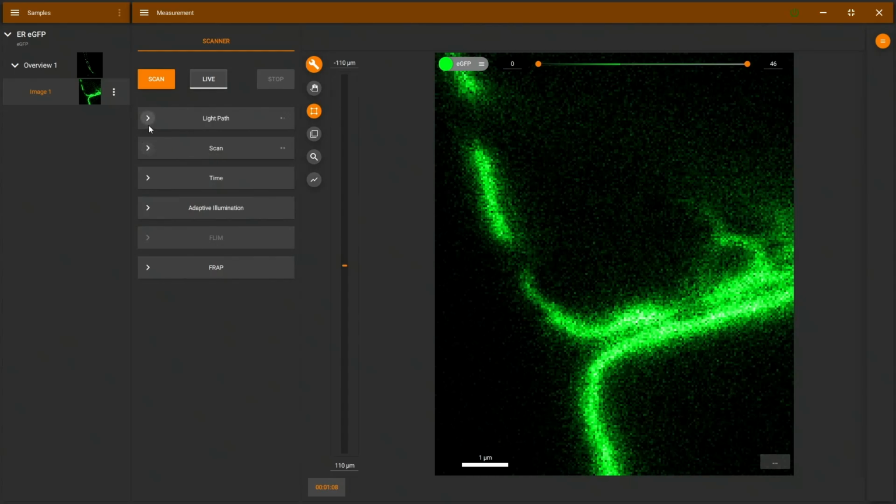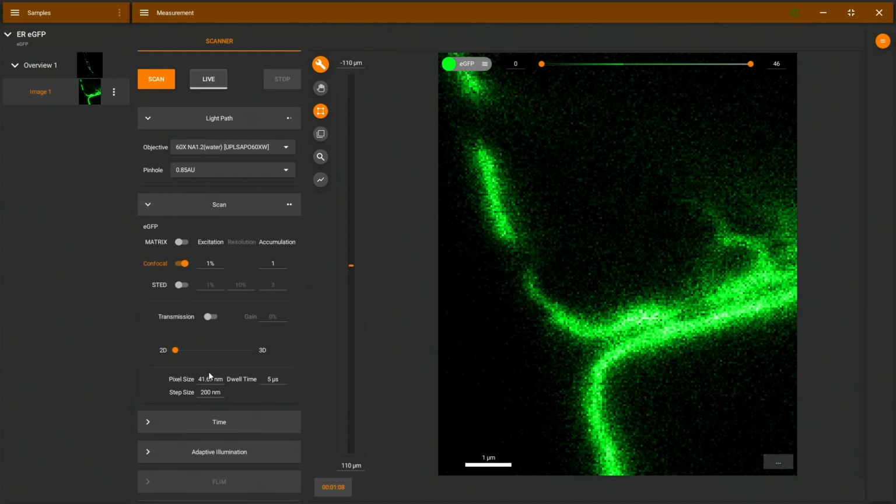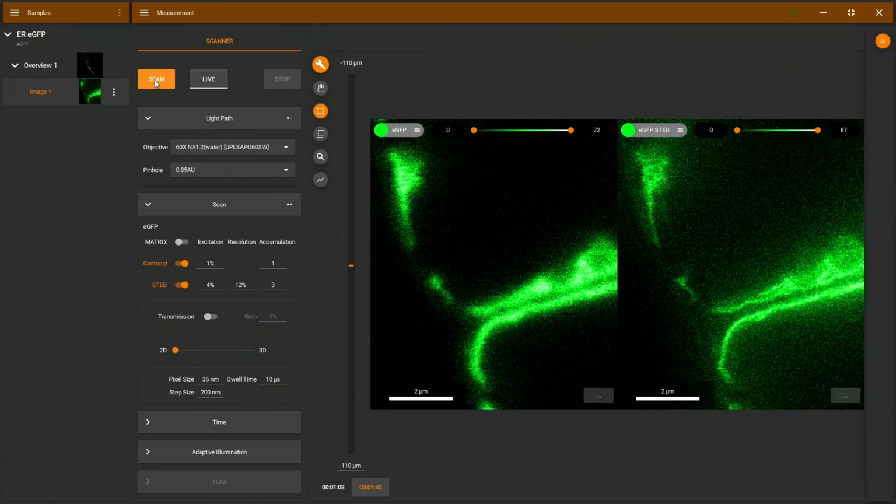So let's see, we go to the scan menu, we make the pinhole a little bit smaller, just to keep it fair in comparison. We will also make the pixels smaller for super resolution. We will crank up the dwell time a little bit, and then we will activate STED. Or increase the excitation a little bit, more STED power maybe. There we go. And if we scan this, we can see on the left the confocal and on the right the STED image. And while we can see in the STED image increased resolution, there's still a strong haze.